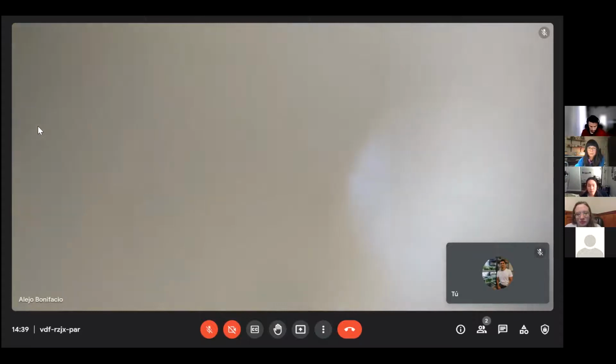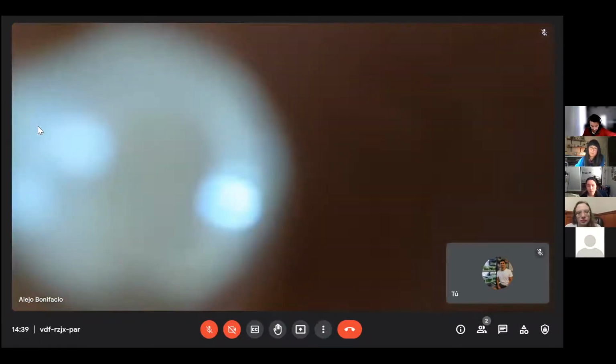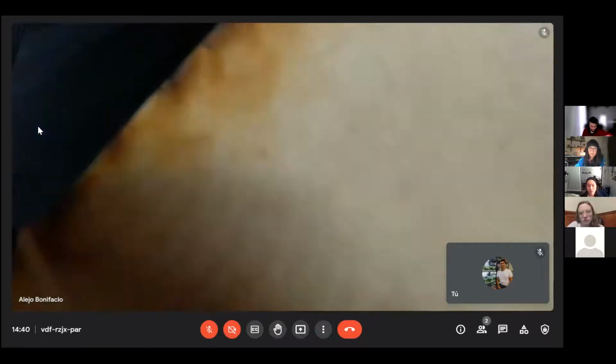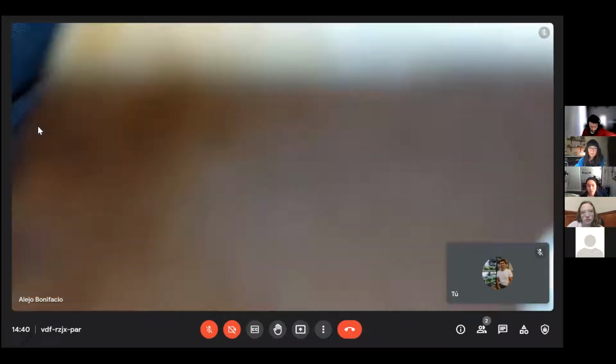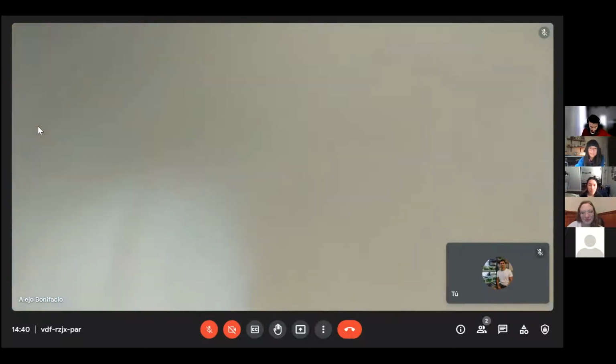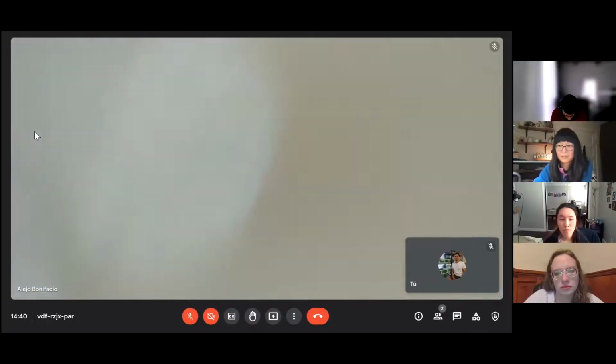This is a quite different microscope model. I see something strange, but I don't know what it is. Sorry, just a minute. Well, it is not in focus. Give me some seconds.